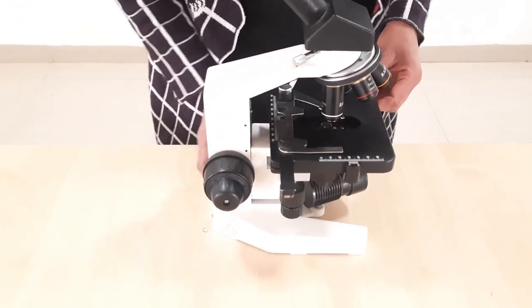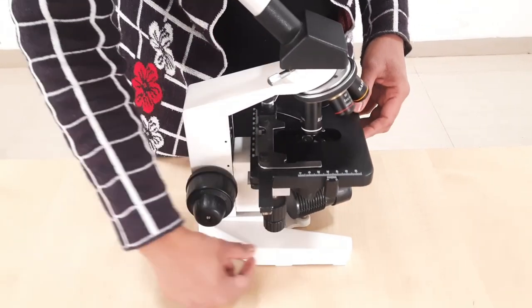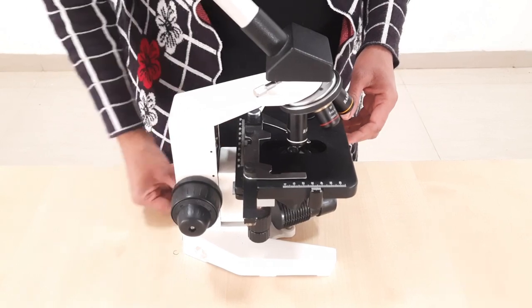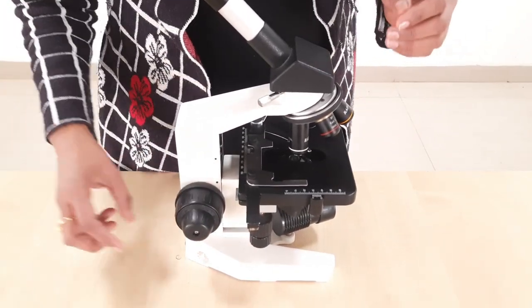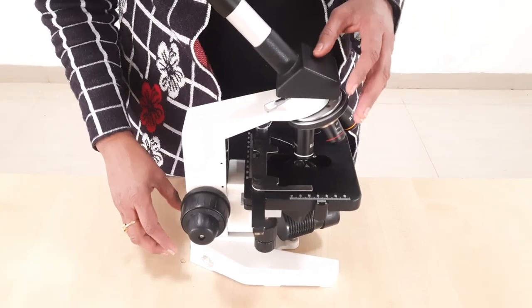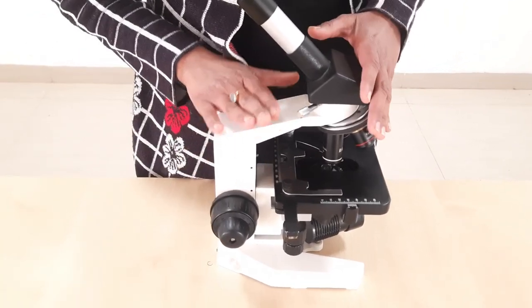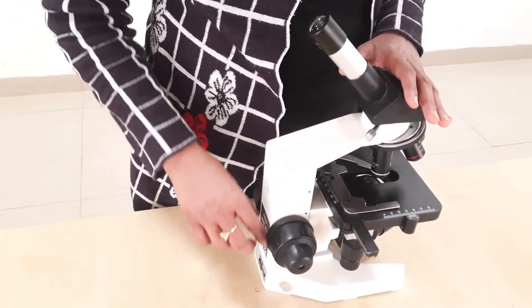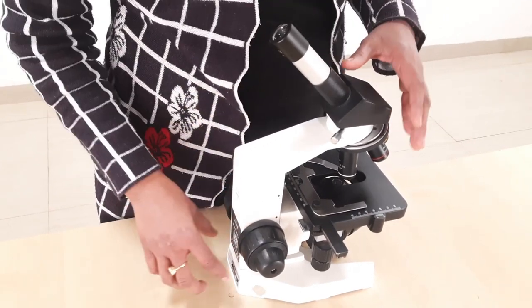The first part of the support system is the base — you can see it is U-shaped or horseshoe-shaped. In older microscopes there used to be pillars, but in this newer model there are no separate pillars.